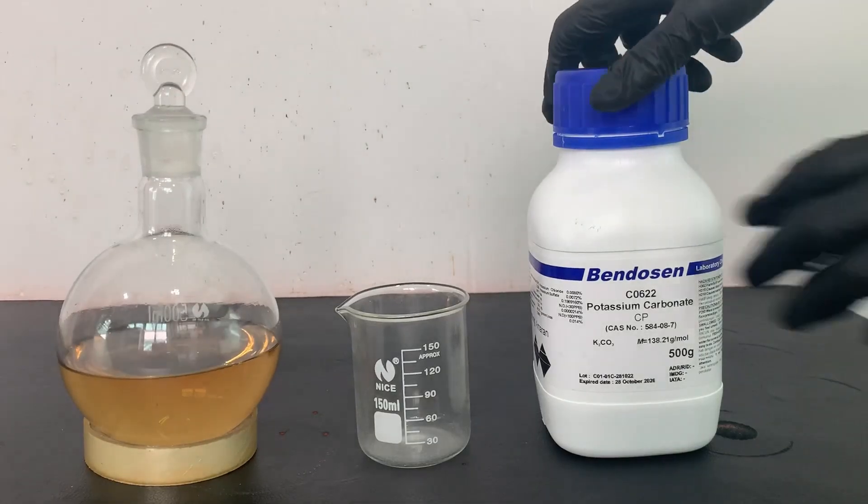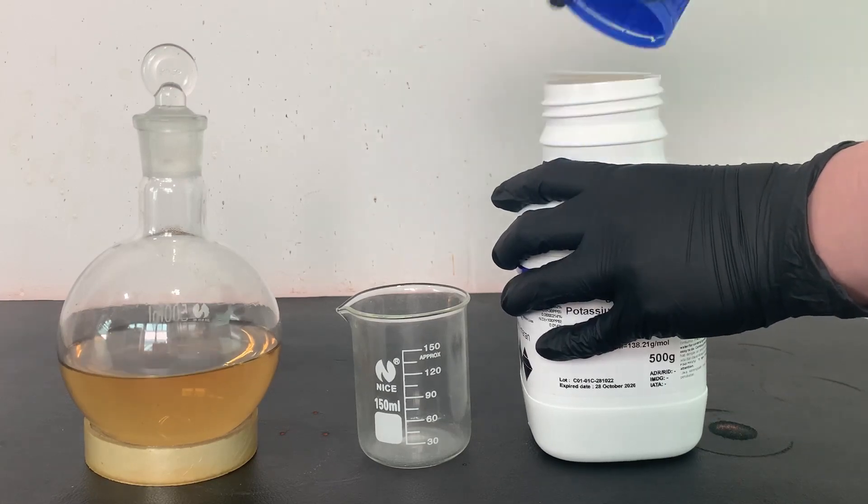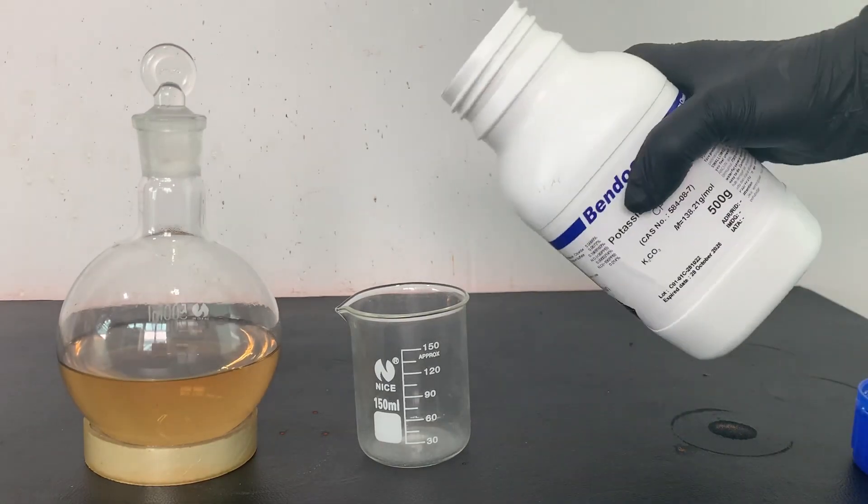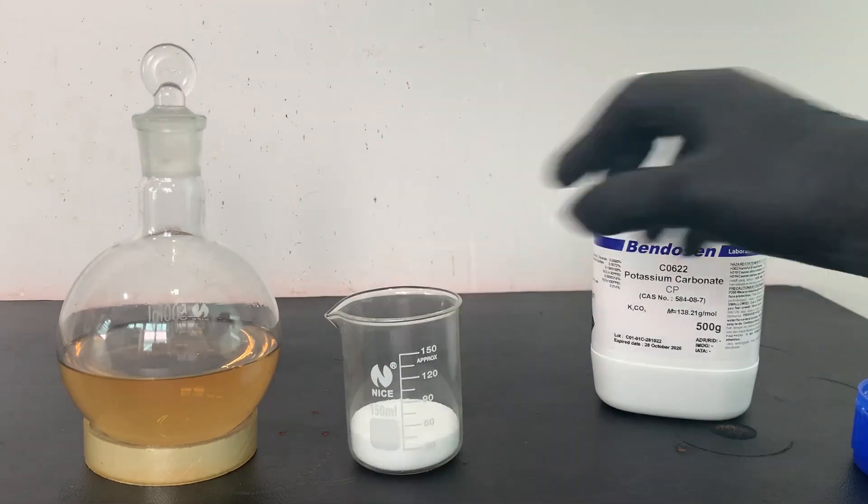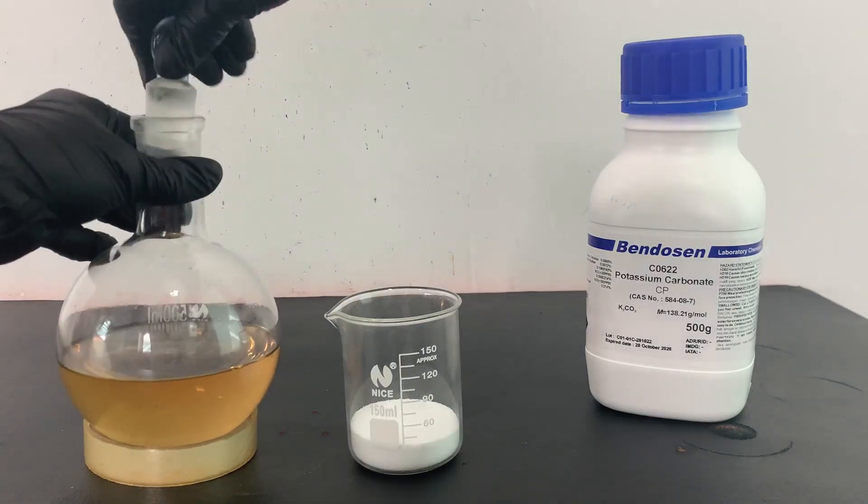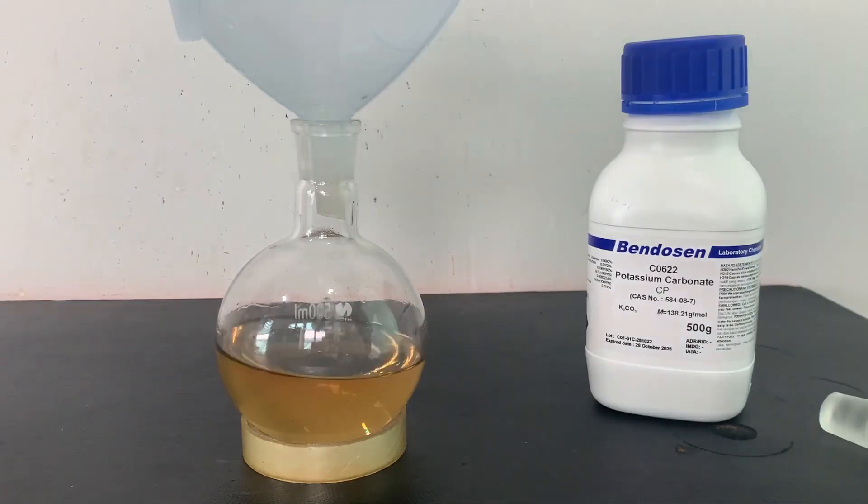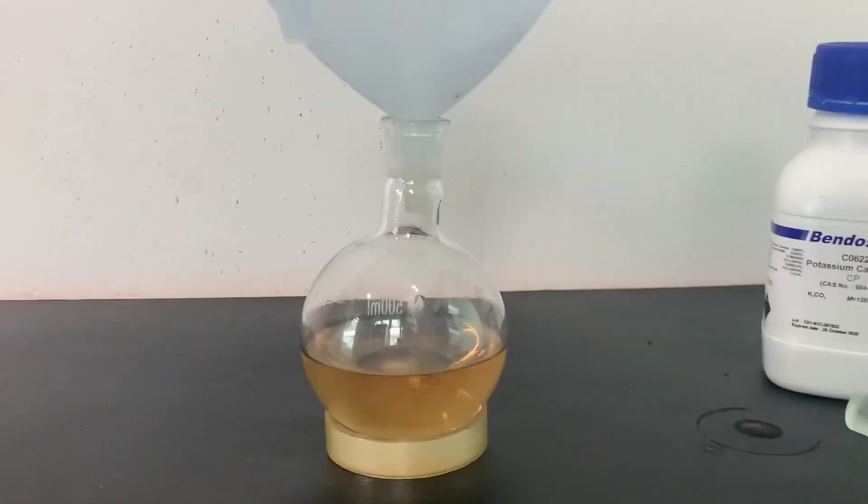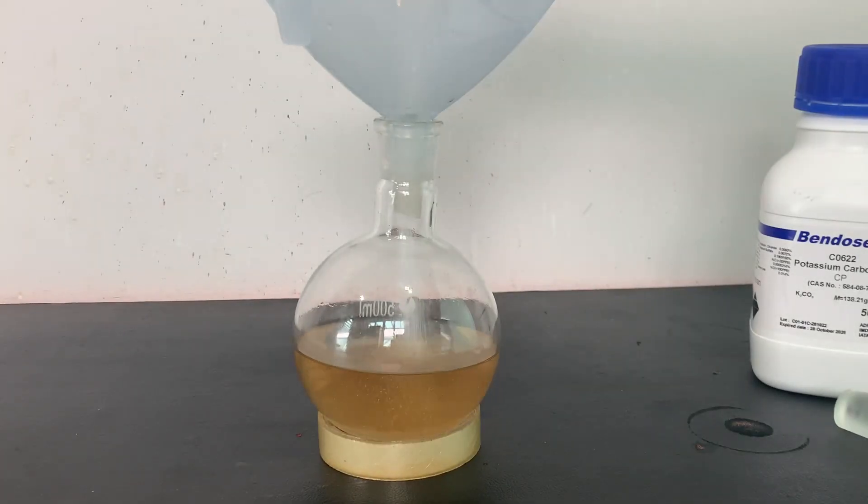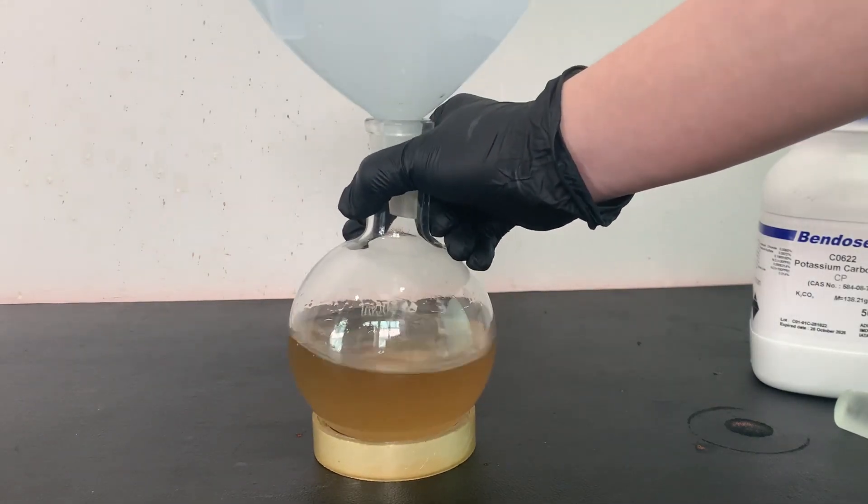An arbitrary amount of potassium carbonate is added to the crude cyclopentanone. This will remove most of the water in the cyclopentanone and also neutralize any adipic acid that might have came over.